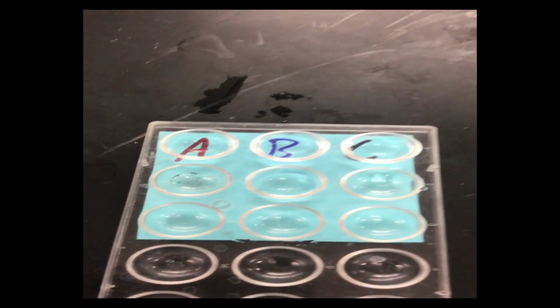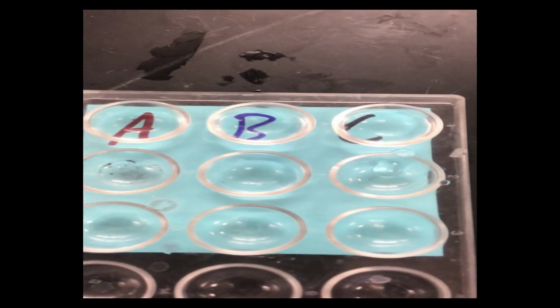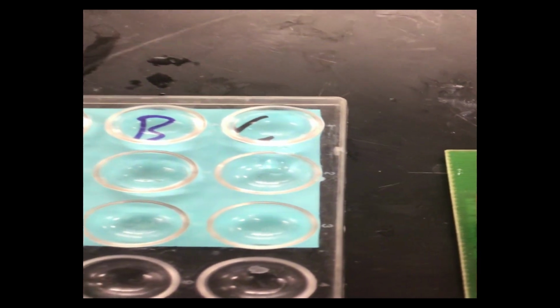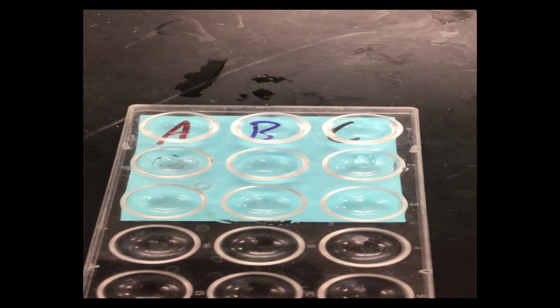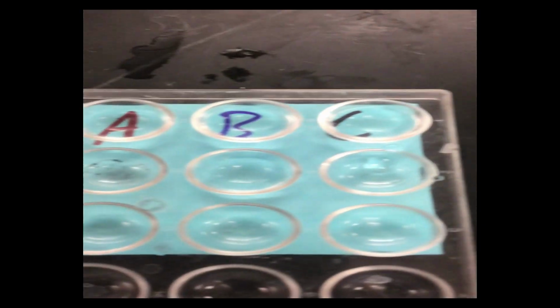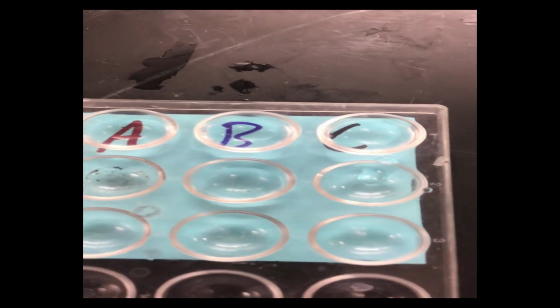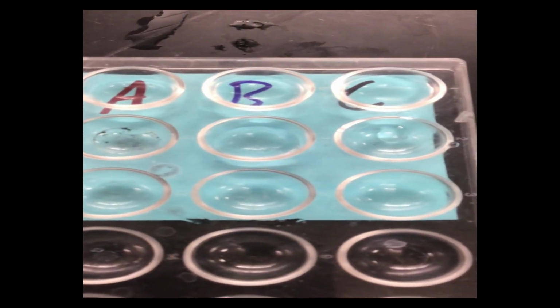And then our last test, if we come over here, is a conduction test. So what we have done over here, it's really hard to see in the video, but there's a solution in A, a solution in B, and a solution in C, okay? So we have dissolved the substances from here, A, B, and C, into water and created solutions, which are already in those wells there. We also have a well right below B that has just distilled water in it.